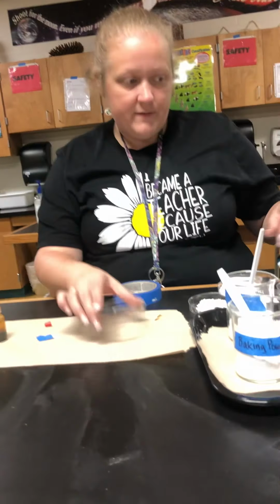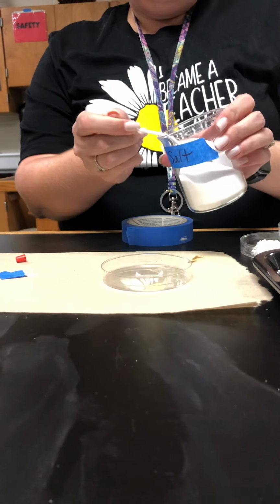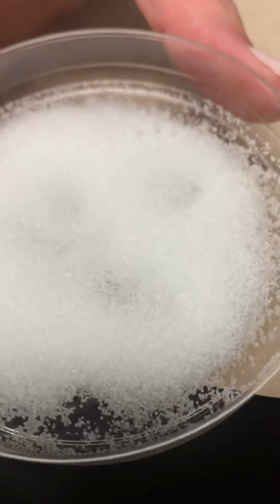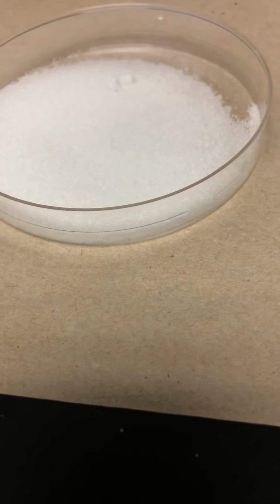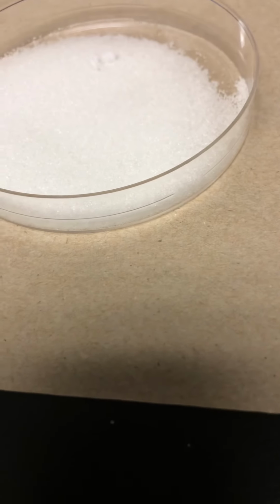Alright, last one we have is salt. Alright, look at it, physical observations. Okay? And now, let's do water.